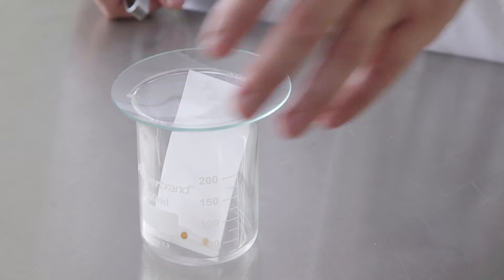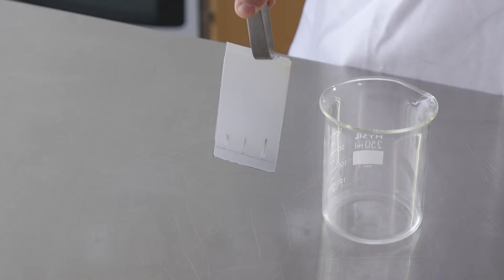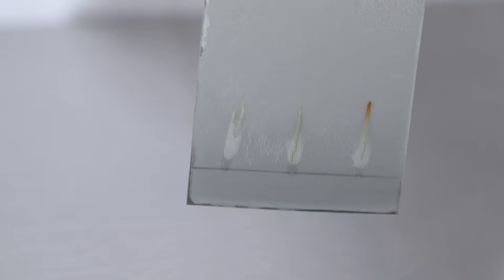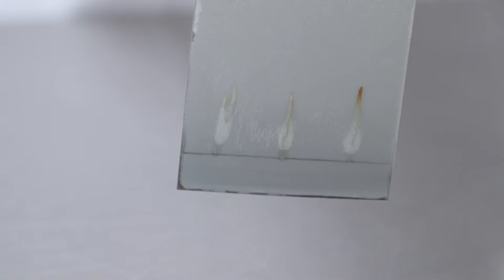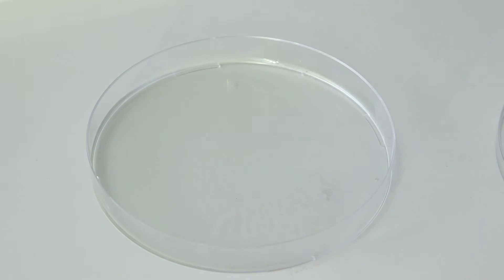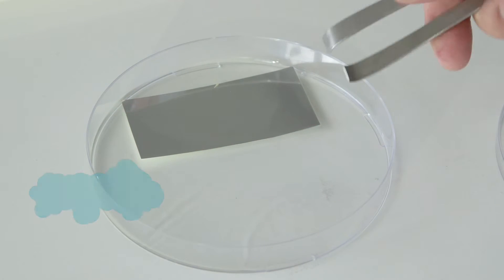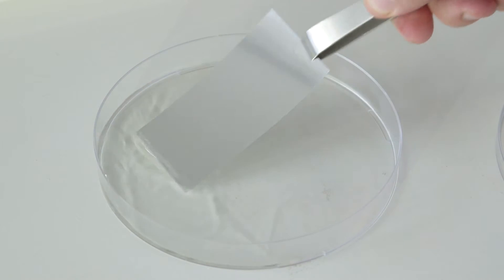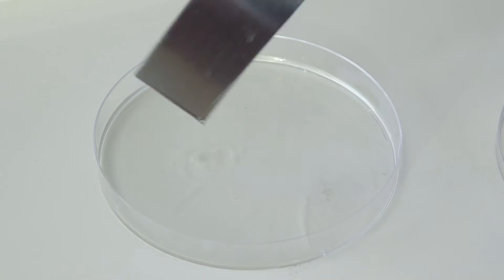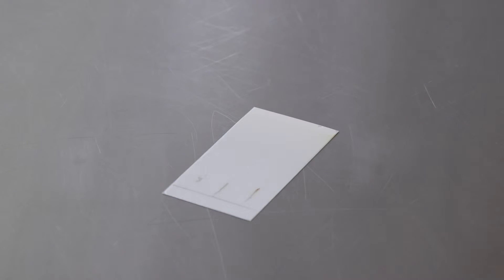Once you've applied the spots, place the TLC plate in the beaker so the bottom just dips into the solvent. Cover and wait. Once the solvent has reached a good height, remove it and let it dry. The amino acids are not visible to the naked eye, so we need to use a reagent which will enable us to see them. The reagent we use is ninhydrin. It is available either as a spray or as a solution.